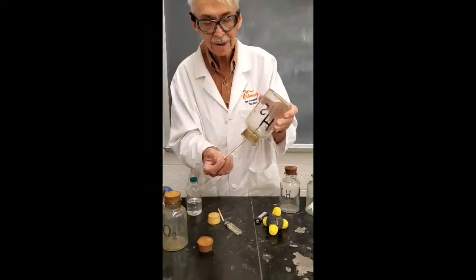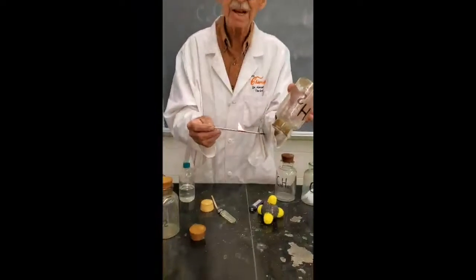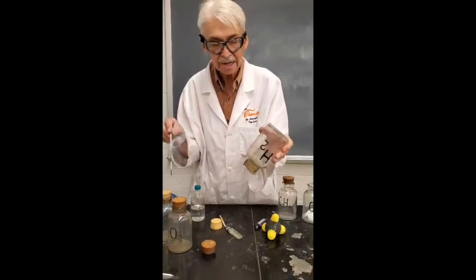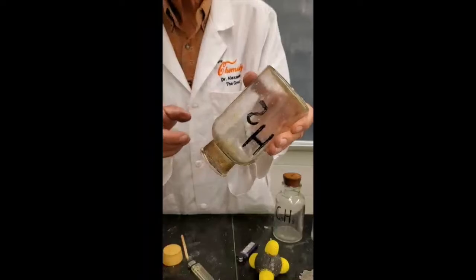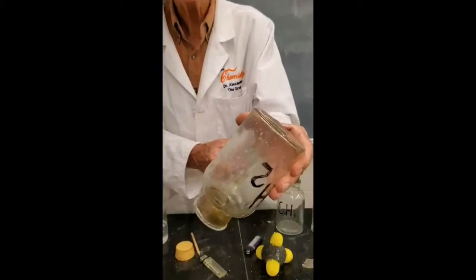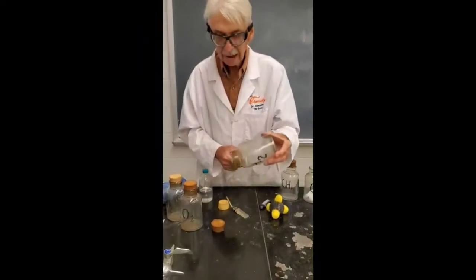You see it burning at the mouth of the bottle? Do you see the fire went out on the end of the stick? And it's burning at the mouth of the bottle, and now it lit the stick in the middle. And now as it burns, I don't know if you can see it or not, but we're getting condensation on the inside of that bottle because the hydrogen is combined with the oxygen in the air when it burns, and it's making water, and when the water hits the cool surface, it forms a liquid. Can you see condensation on the inside of that? Okay? Now I have an idea.